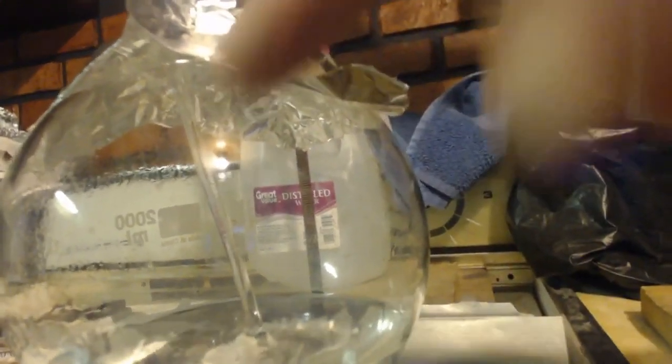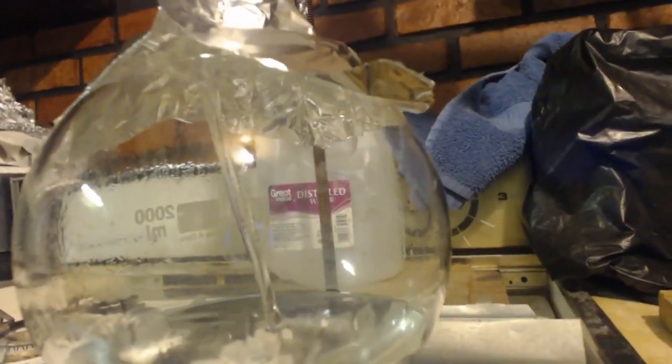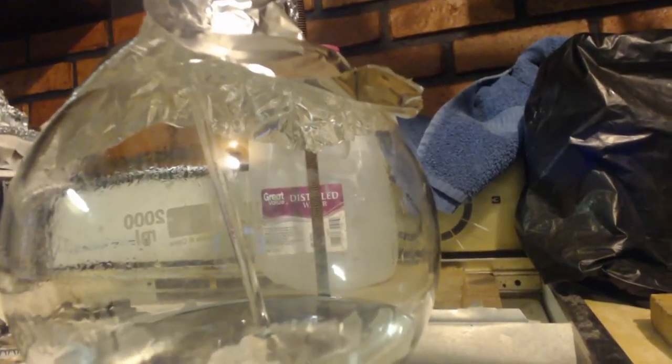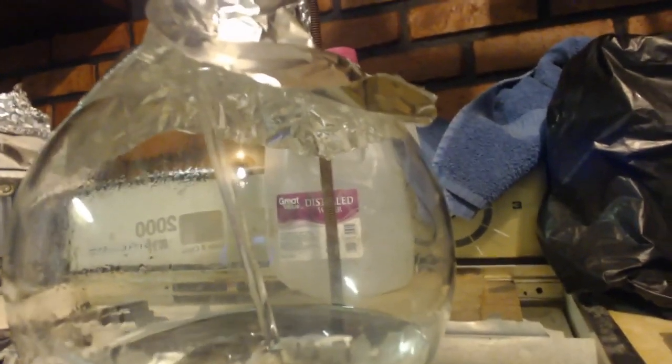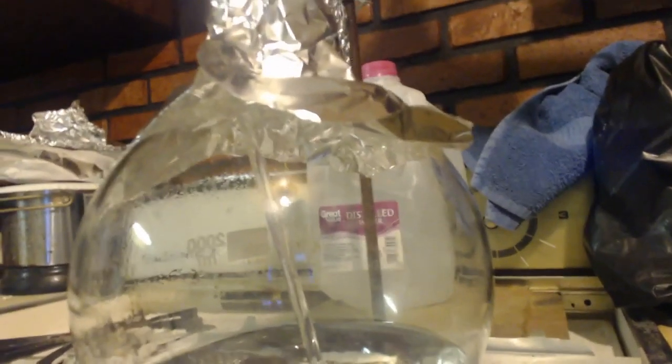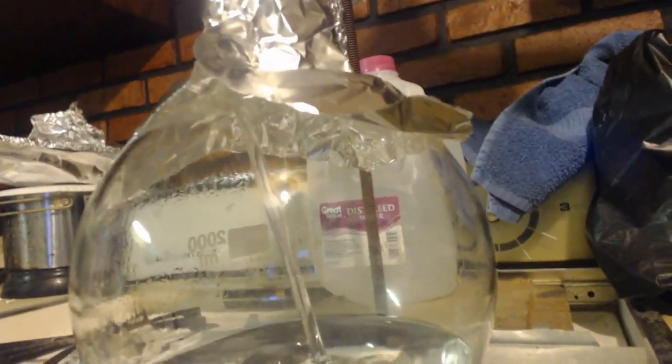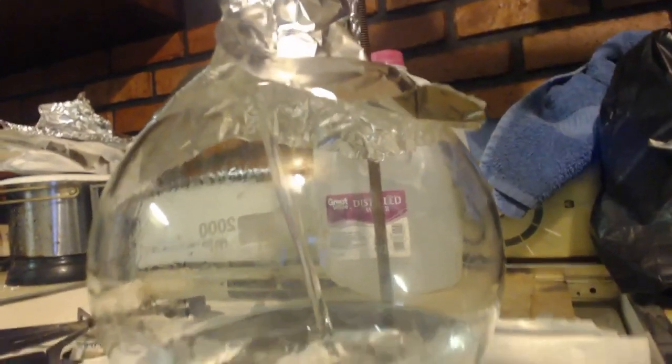Because if you think about it, a big bubble creates, it has to slice through that vertical stir rod. And when it does, it will break the bubble. I'm not saying you can jack it up to a million degrees. There's an extent of how much it will work. But it will definitely help when you're worried about bumping on a specific experiment or whatever. See how it just goes straight up and down no matter what. It's going to have to slice through there if any big bubbles are created.